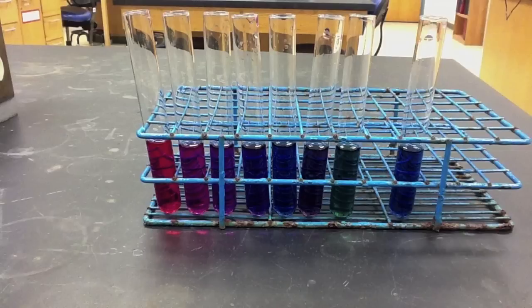On a final note regarding anthocyanins, I have composed a time-lapse video that shows a 15-minute period of the pH 12 buffer and anthocyanin mixture sitting at room temperature. Notice the distinct color change that occurs over this 15-minute time period.